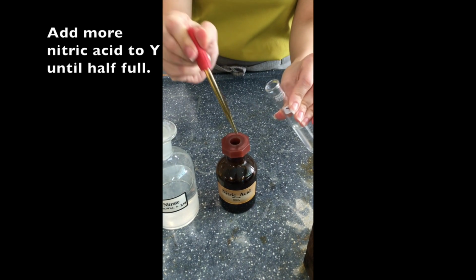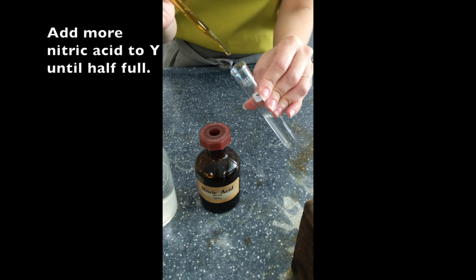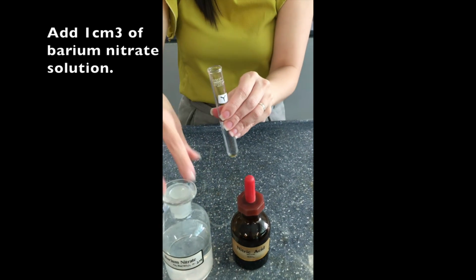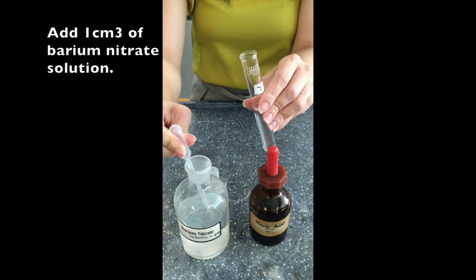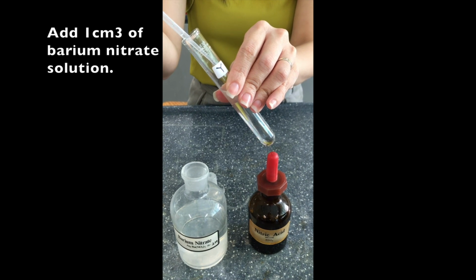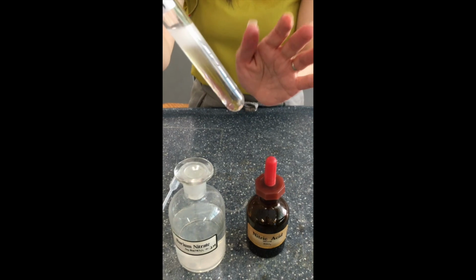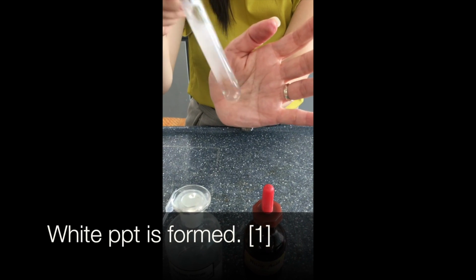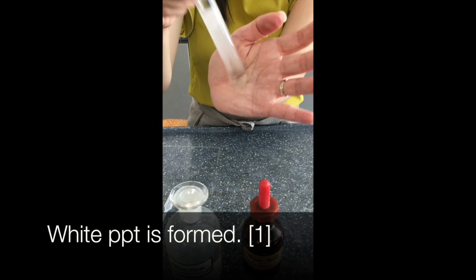Next, we do it for Y. Again, we add until half full. So in this case, we should also see that there is no visible change. And then we add 1 cm cube of barium nitrate solution. And this is where you will see your white PPT. Okay, so you shake so that you see the white PPT spreads throughout the mixture.